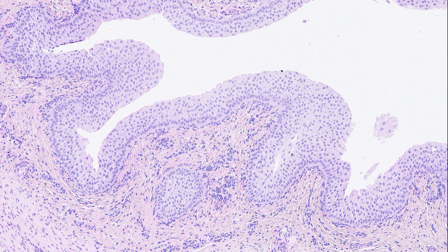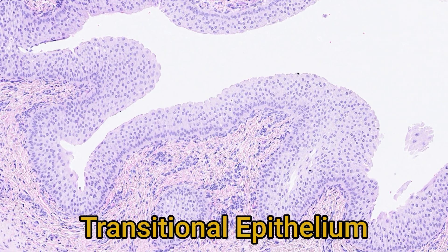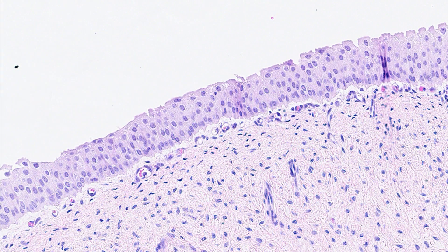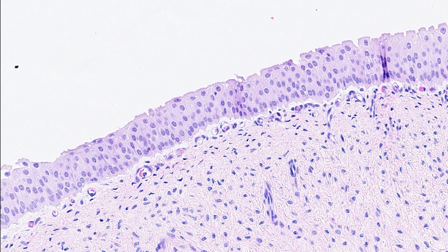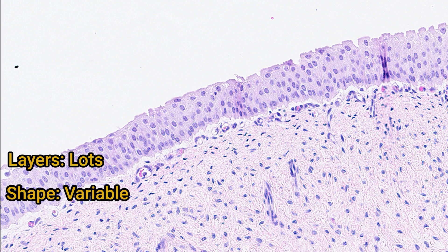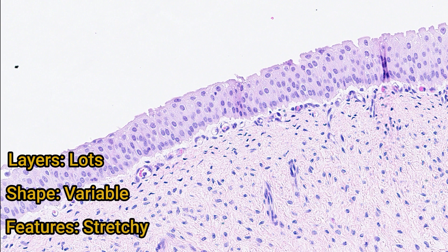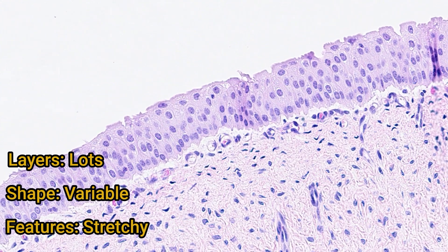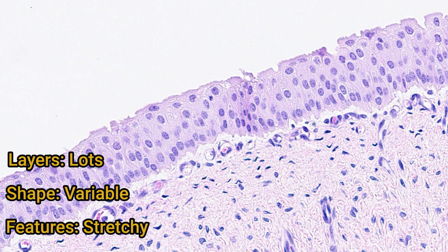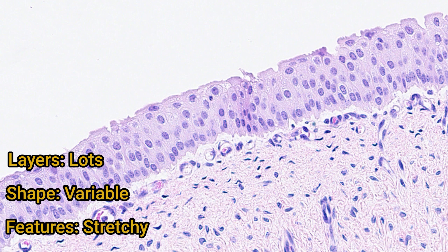Moving swiftly on, we reach our final epithelial type: transitional epithelium. Transitional epithelium is found in the urinary tract, specifically from the renal pelvis to the urethra. You see that there is more than one layer of cells, so it can be described as stratified. The shape of the cells varies from cuboidal to flattened. The main property of transitional epithelium is to accommodate the wide variety of sizes that the bladder can be — it wouldn't be much good having a static, skin-like epithelium, as the epithelium would tear apart when the bladder expanded. Instead, transitional epithelial cells can adapt their shape: when the bladder is large and full of urine they flatten out to cover more area, and when it rapidly decreases in size they spring back to their original cuboidal shape.